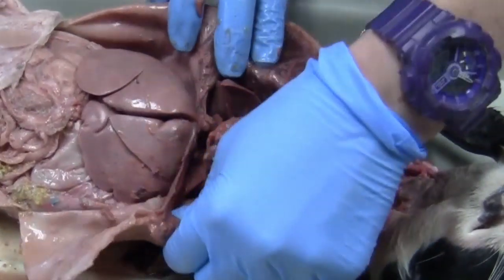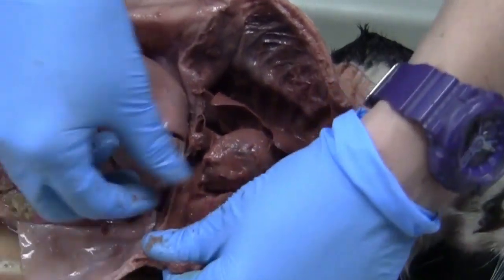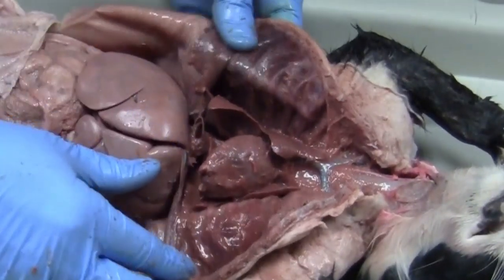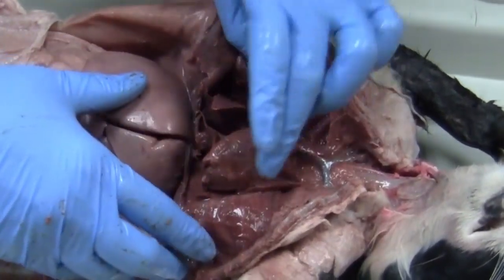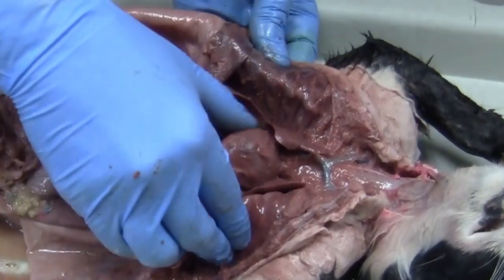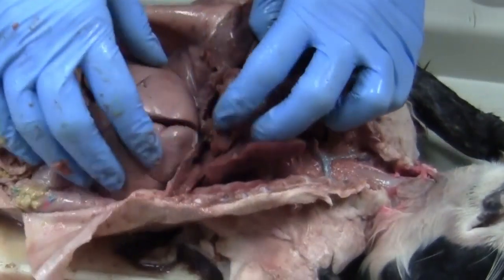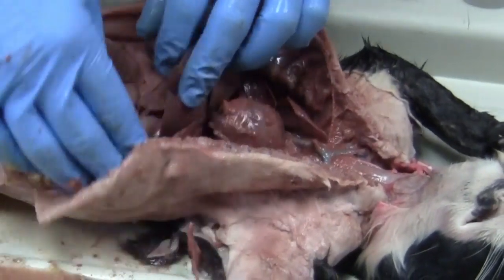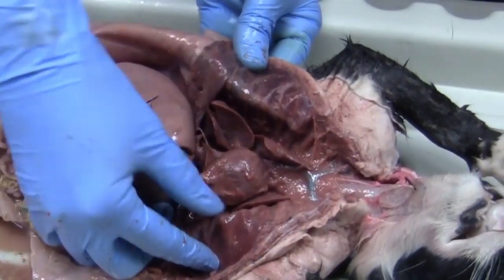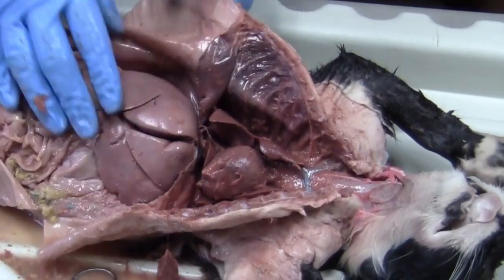And if any of you have ever taken the meats class or anything, you hear them talk a lot about KPH. And so a lot of this kidney pelvic heart fat is what I'm kind of taking out here and putting on the side just to clean things up. So there's quite a bit of that covering. This cat actually is really not too fat, so she doesn't have a lot, but she definitely has some around the heart and the lungs.